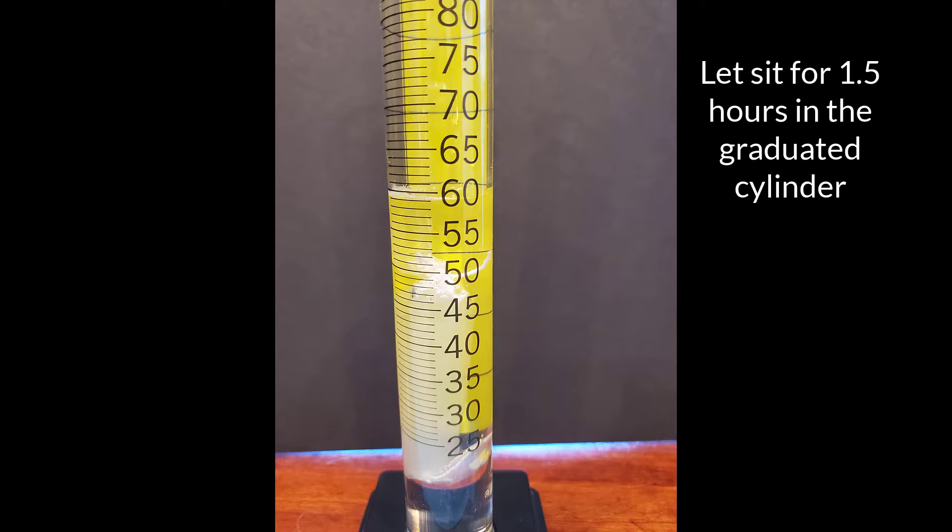You can let that dialysis bag sit in the graduated cylinder for about an hour and a half to allow dialysis to occur. Now typically we would use a beaker but it's really hard to get the dialysis bag out of the graduated cylinder once it's in. So just go ahead and leave it in the graduated cylinder to allow dialysis and osmosis to occur.